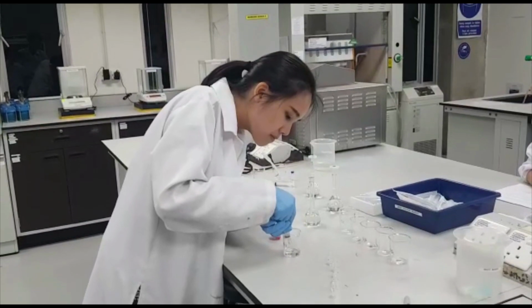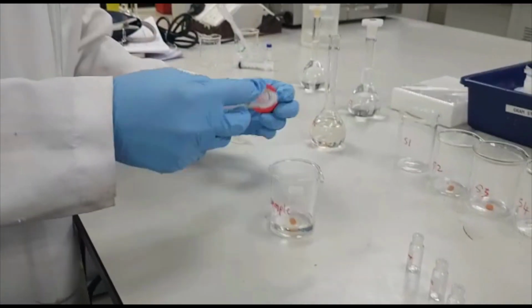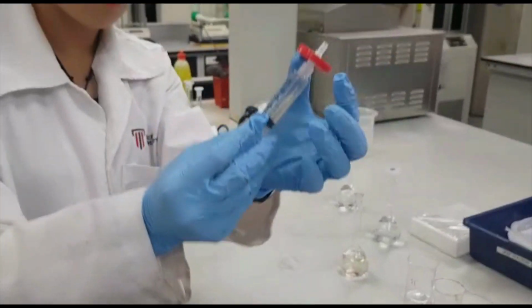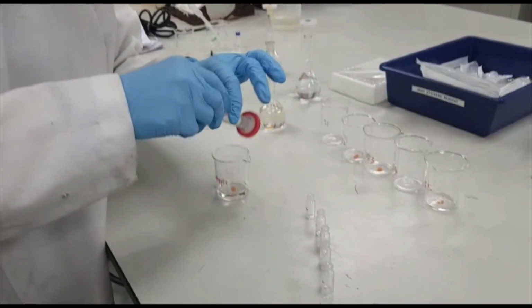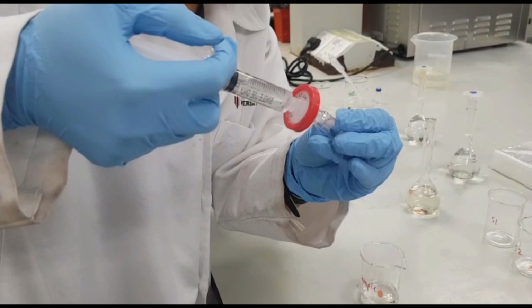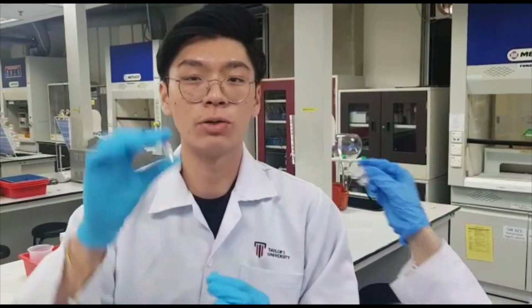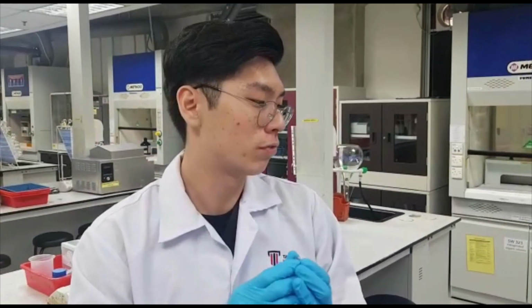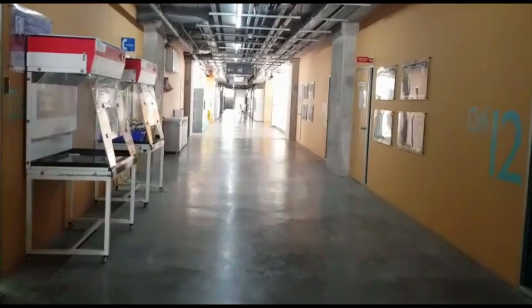Now, the diluted tea sample is filtered by using a filtration syringe to remove all impurities to avoid clogging of the HPLC system, so that the machine won't be damaged. All of the sample and standards have been moved to the vial tubes, and now all of them are ready and sealed in the instrumentation room. Stay tuned with us. We are heading to the HPLC instrument room to perform HPLC analysis.